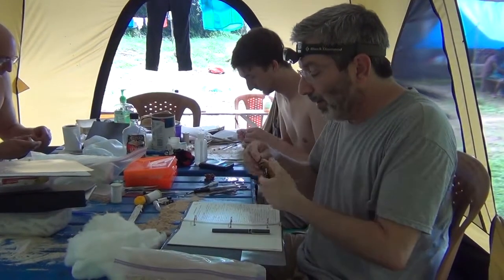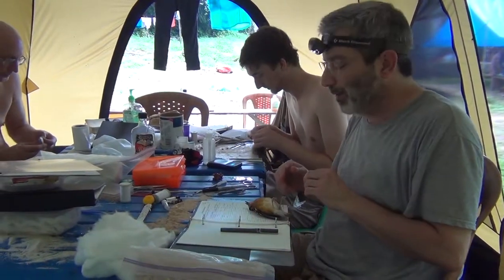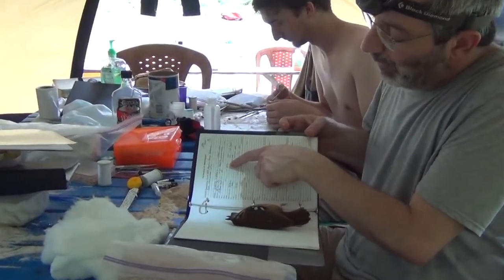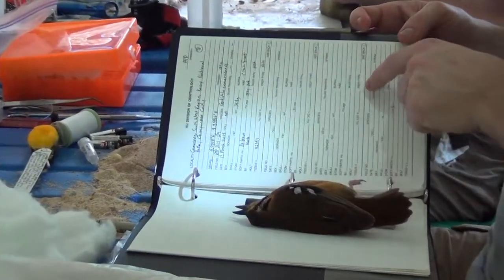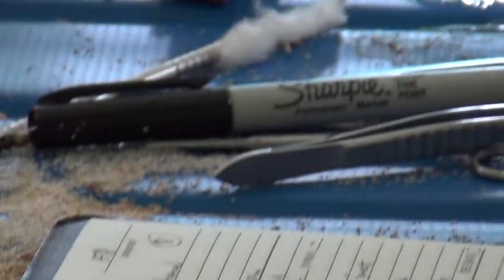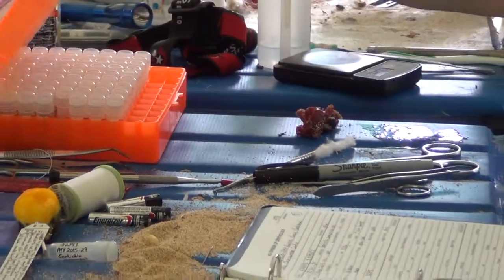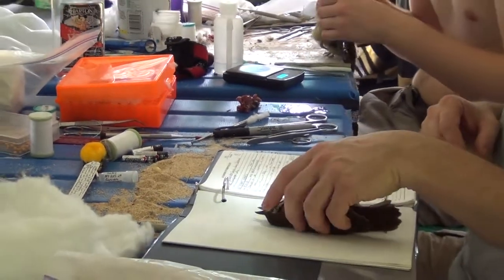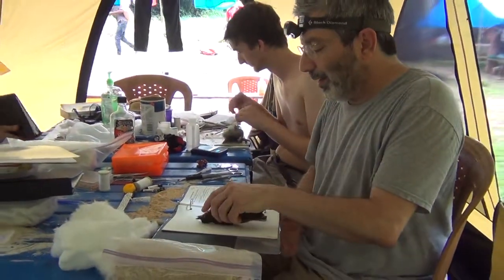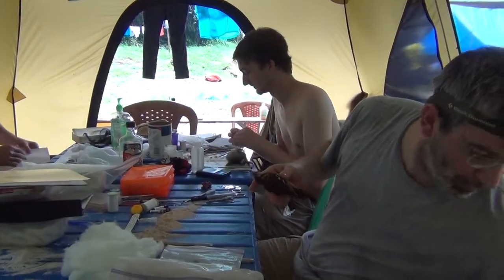As a first step, I have already taken photos of it in life so that we get its soft part coloration in detail, and I have noted down its body mass, how it was collected, and soft part colors as a textual description. I have a number for frozen tissue, and that corresponds to the number on this tube, which will be stored and then taken back to storage in liquid nitrogen vapor in the museum. So we've got a lot of data already in hand, and we'll come back to the catalog at various points in the process.